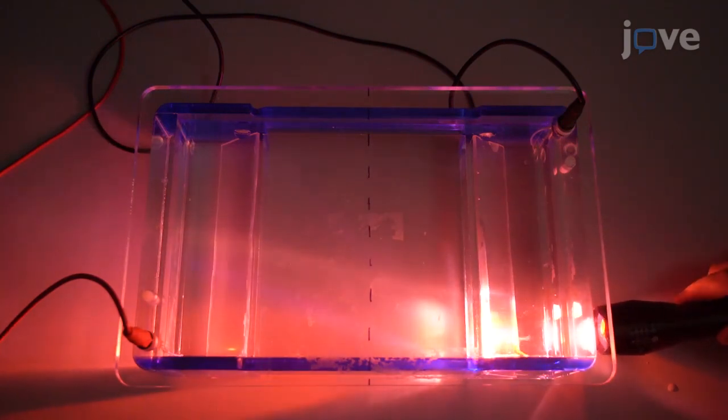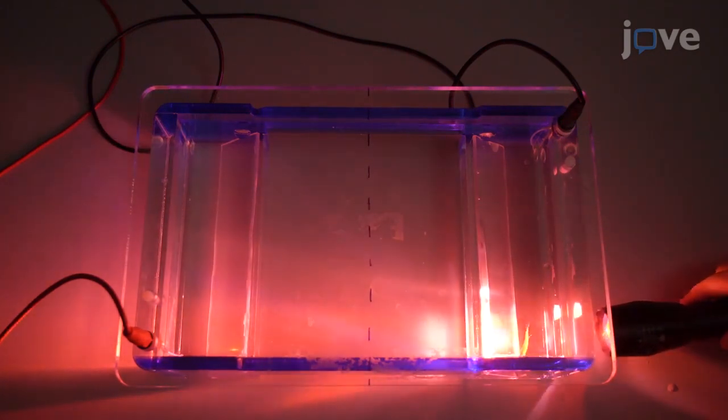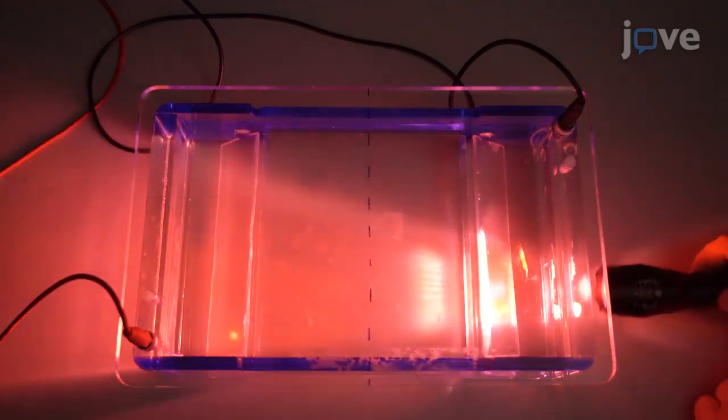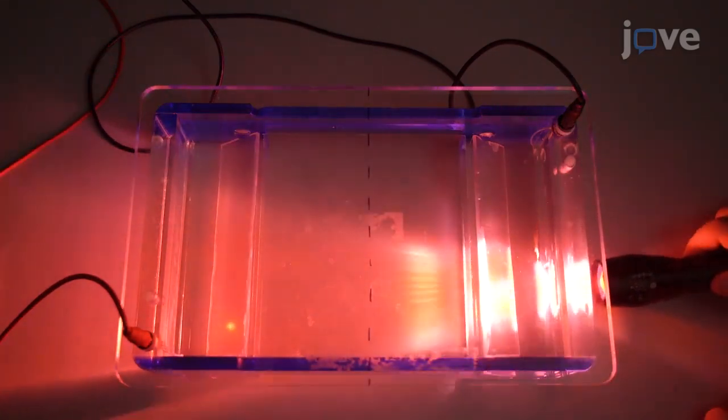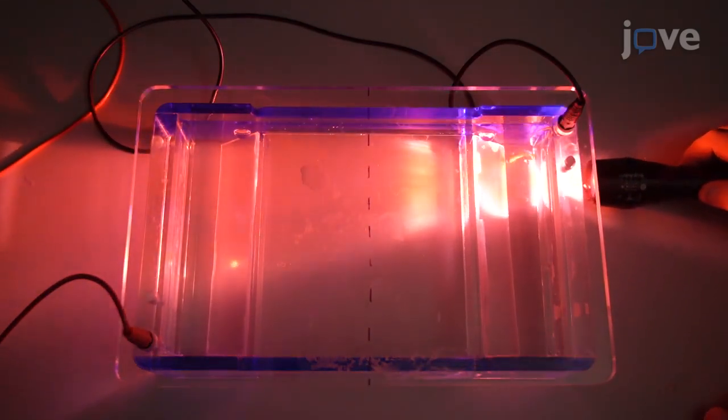Do not start a trial if the fish is resting next to the platinum wire. Shine the light stimulus directly on the fish and manually follow any lateral movement of the fish with the light to ensure continual visualization.